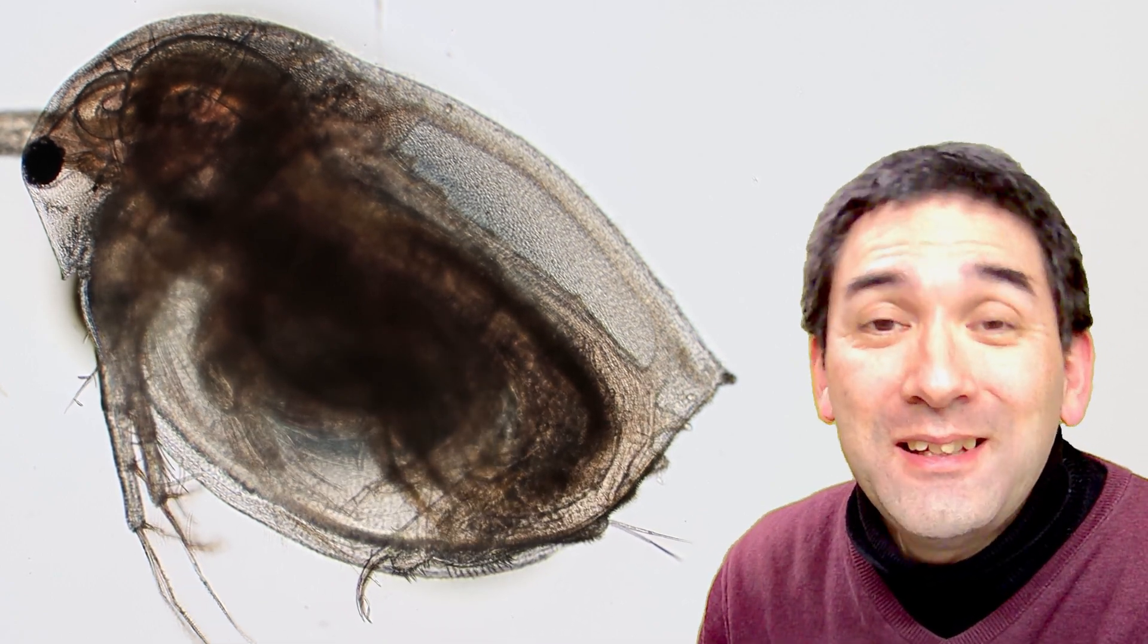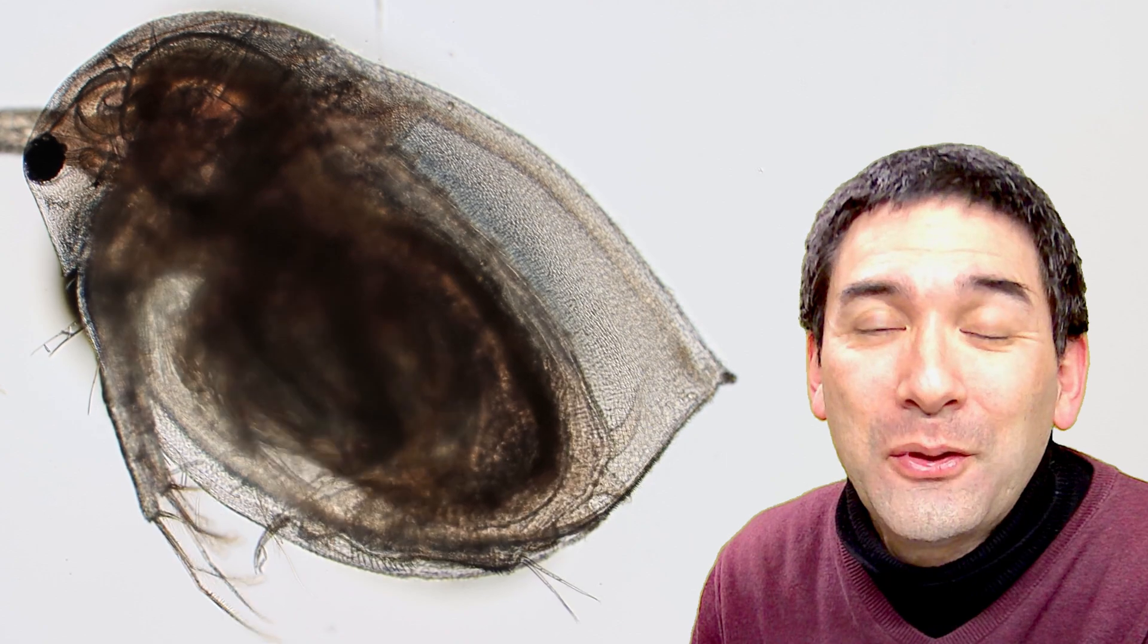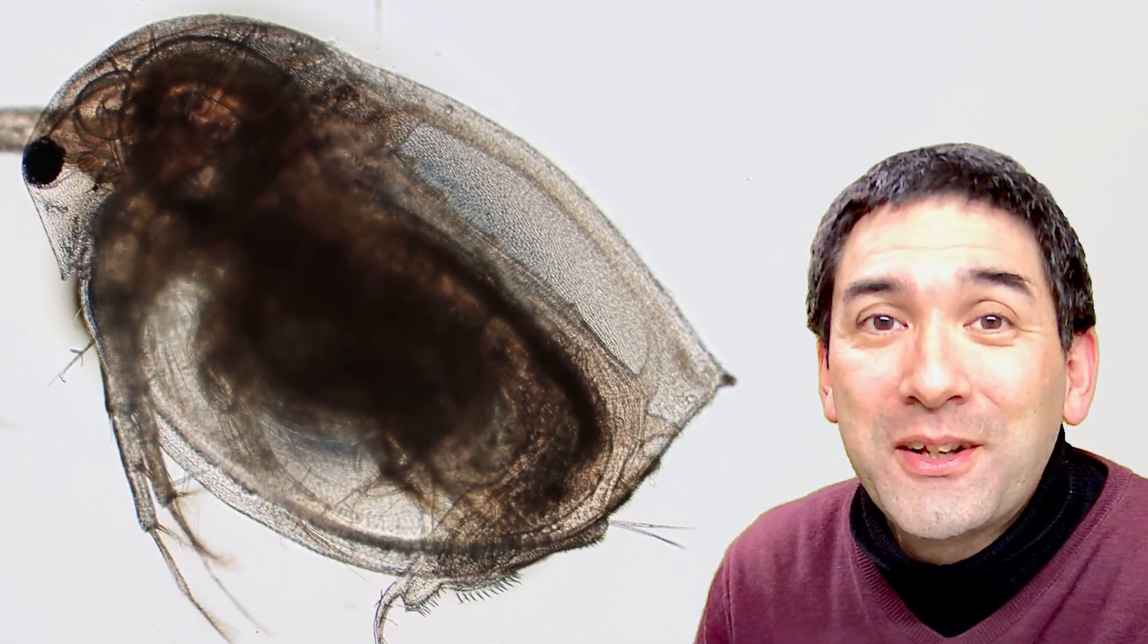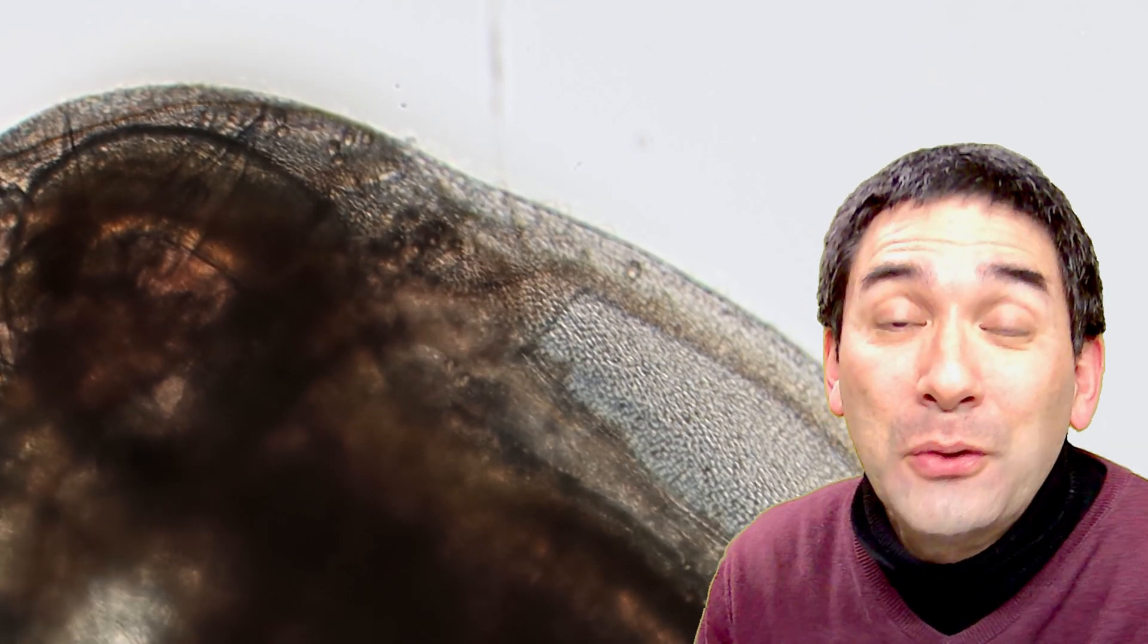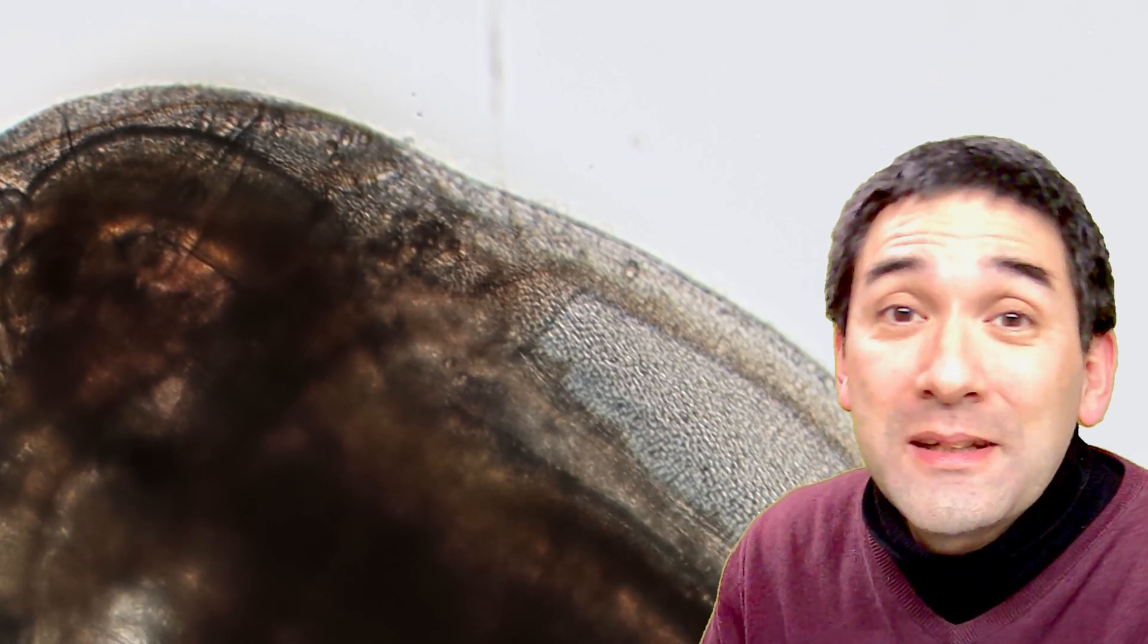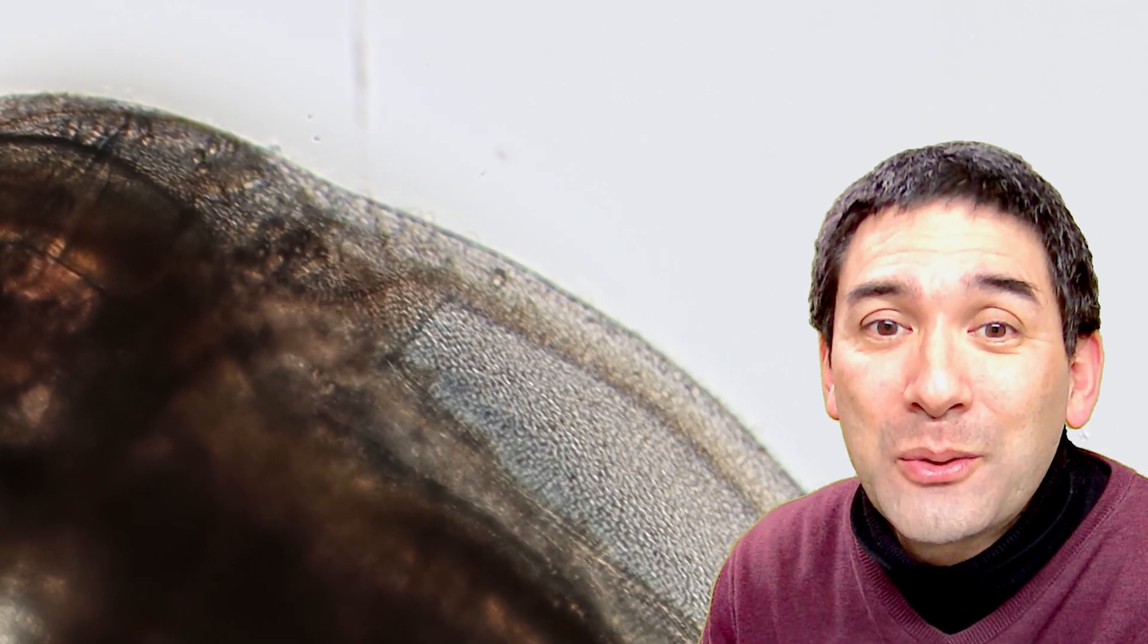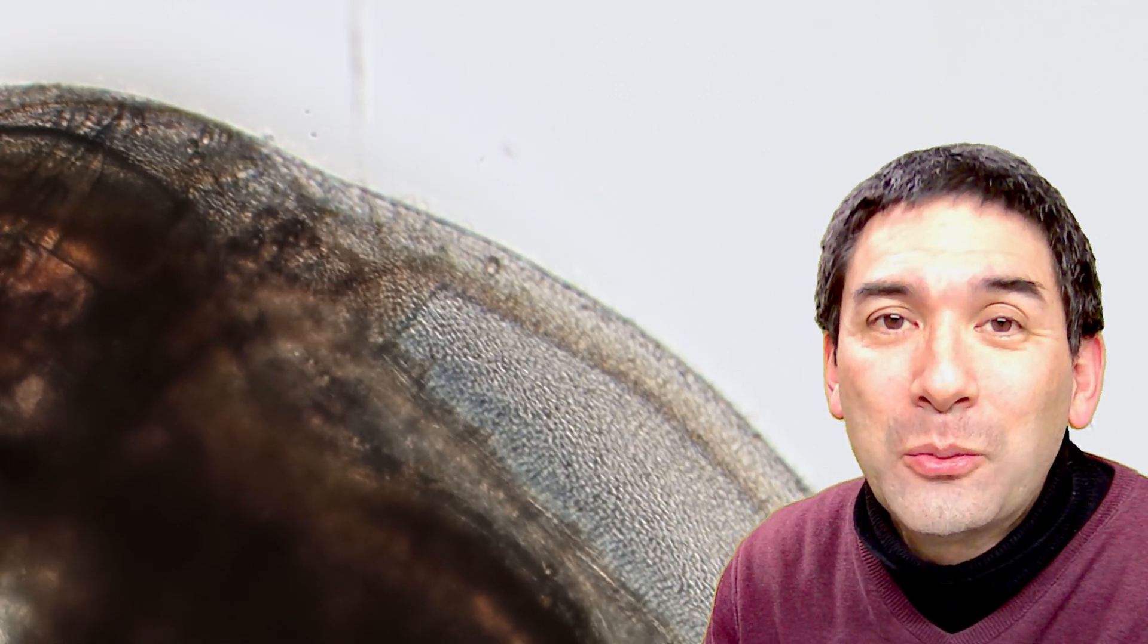So very interesting and easy to do little experiment with those water fleas, of course. It's also possible to try other tiny water animals, how they respond to a variety of environmental pollutants and chemicals, and in this case of course also alcohol. And now you can see that we're all the way back to the normal heart rate again.